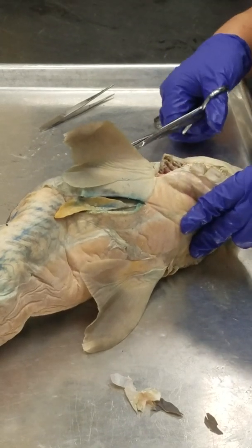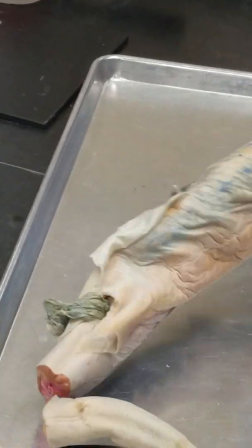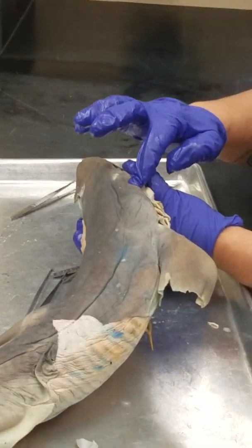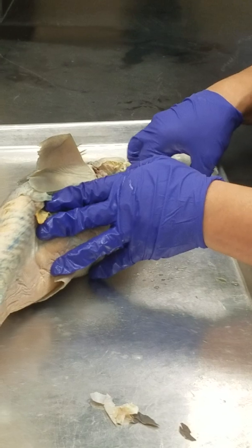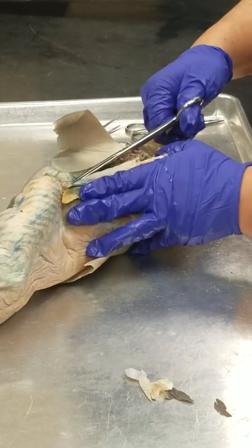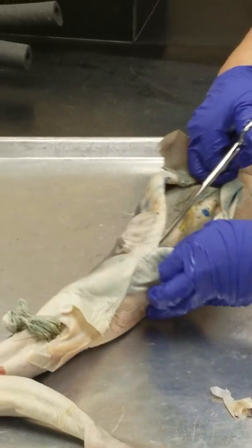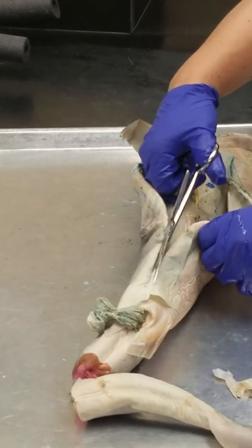Where is the jaw located? It's the actual jawbone itself. So here's the mandible. This upper part here is your palatoquadrate. And then right around here is your hyoid. Is there a spiracle on each side? Yes, there are two spiracles, a left and a right. And the spiracle opens to the inside too. So the spiracularis helps to pump water over the gills when the shark's mouth is full.